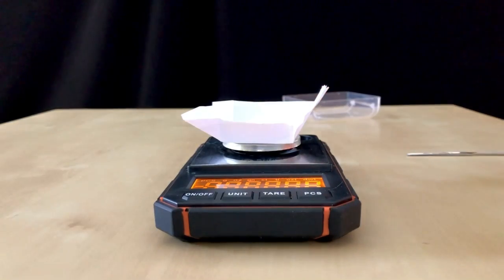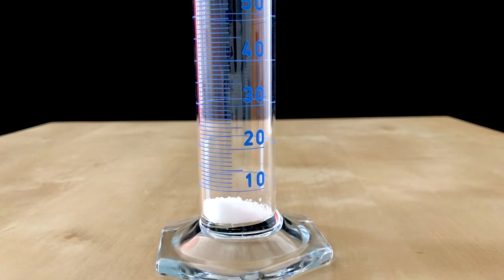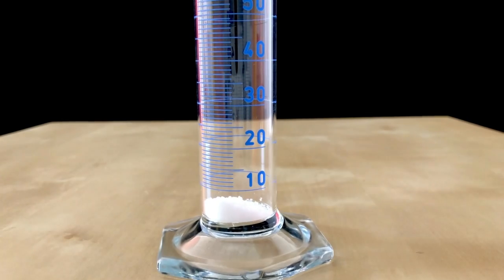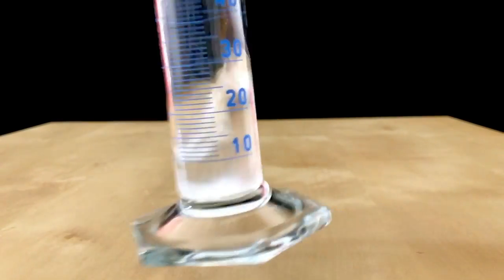It would also be possible to clean the spatula before using it, but as you can see I am even using paper trays and there is a reason for that. The potassium iodide was added to a measuring cylinder and afterwards some distilled water was dumped in.